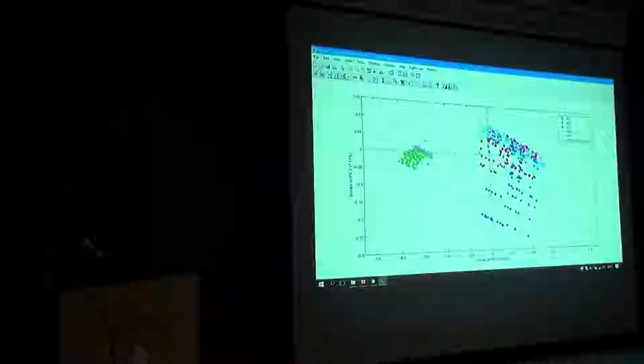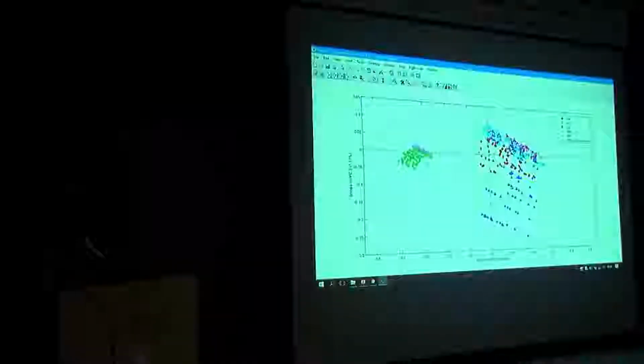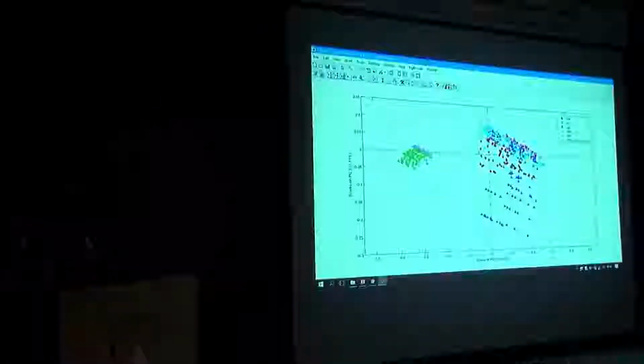So you can see potassium chloride is creating a completely separate cluster here. This is a little bit strange because I think it has something to do with the experimental design, that this is clustered separate from the rest of the data set. But anyway, we include them. If you look at the pure water, PW, you got pure water here, pure water here, and here. So you got 3 clusters of pure waters as well. So it could be a day-related feature.